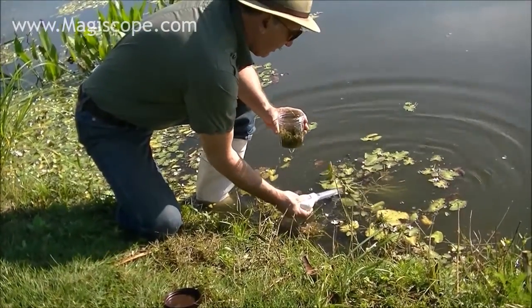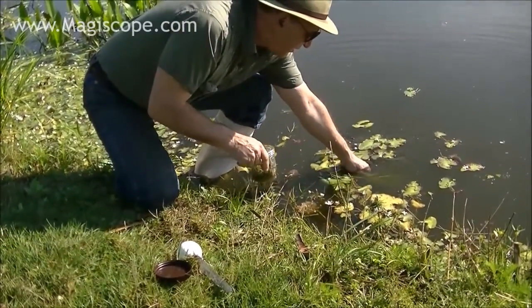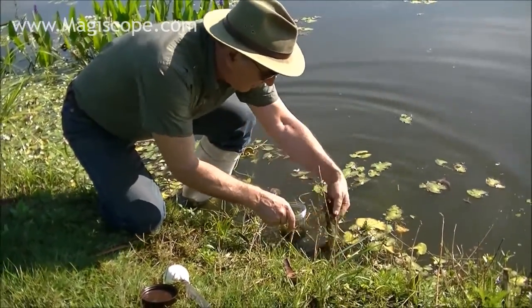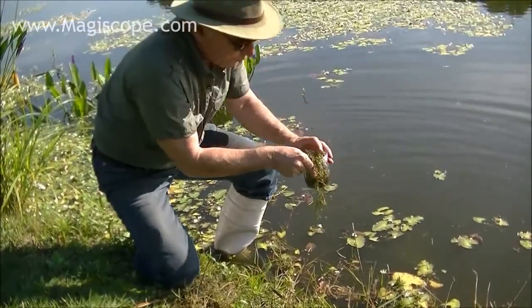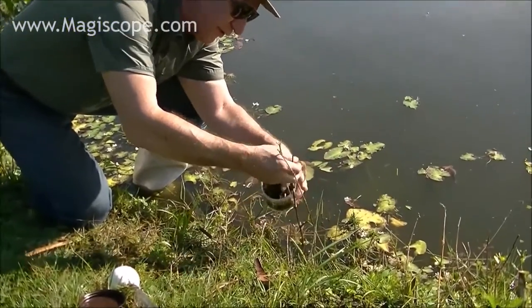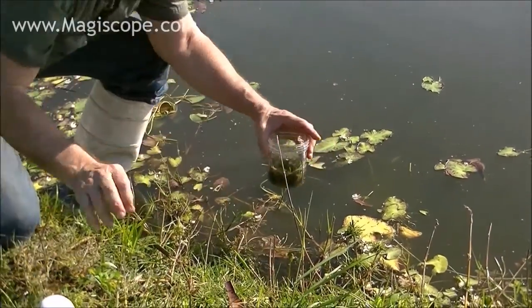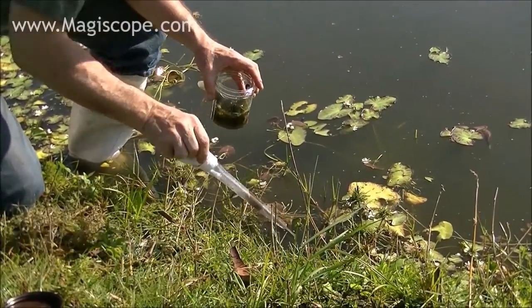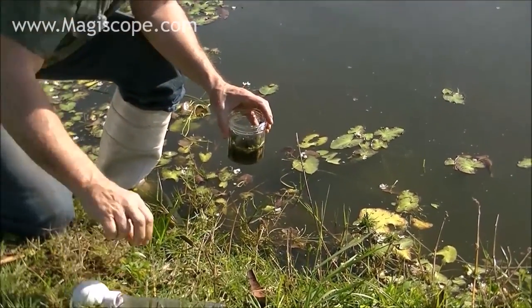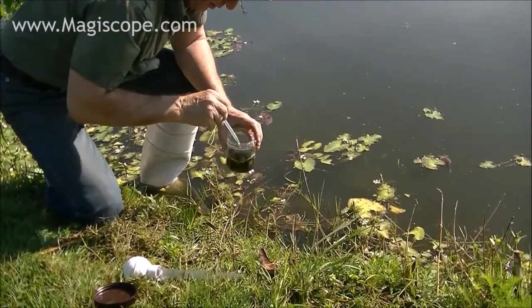Take it from the very surface of the water, stir it all up to get them moving, then take more from the surface. The good thing to do is if you can take a plant out that's got enough stuff on it and just basically pull it into the jar. If I have something like a huge root system, I might just stick the whole thing in there — something's going to be hanging around in every part of it, along the edge, along the bottom. The turkey baster is fast; I could use a disposable pipette, but you can get it all at one time with the baster.